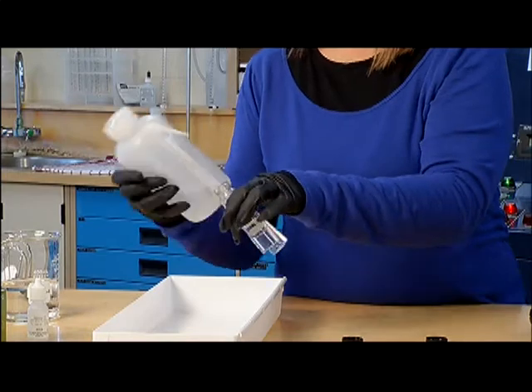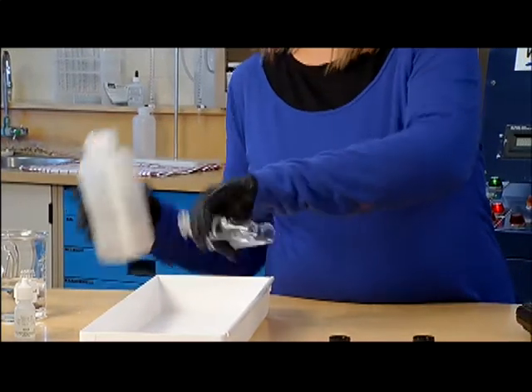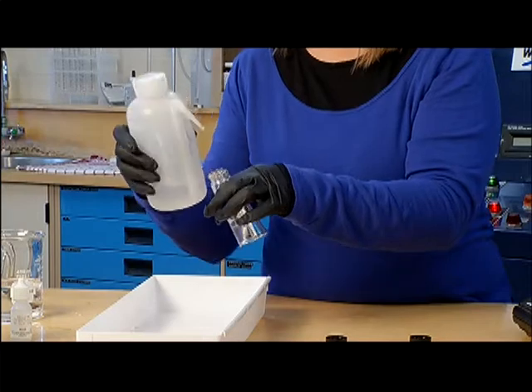The operator removes the lids from the sample cells. Ultra-pure water is used to rinse the sample cells.